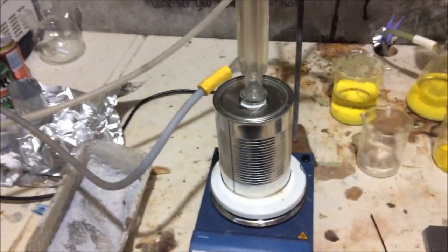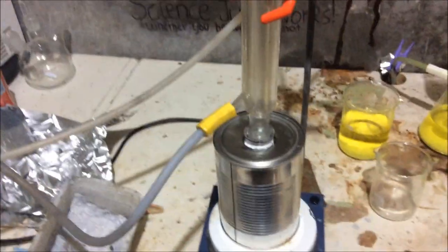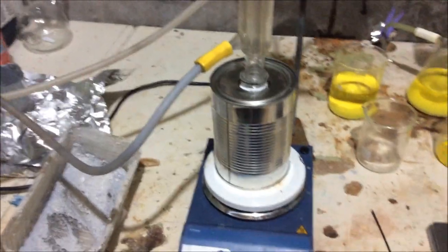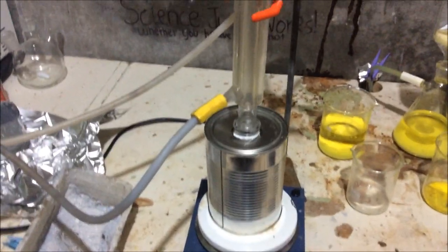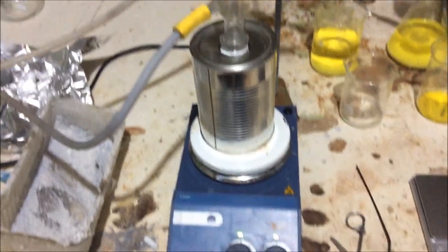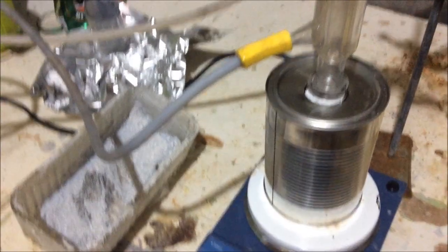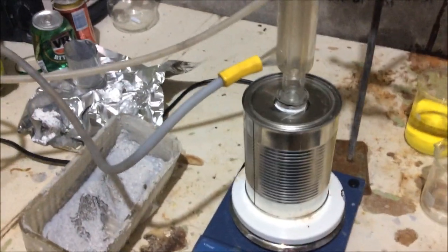The condenser's attached. We're about an hour in and it's refluxing pretty steadily. You can't really see on the camera, but I can see that it's condensing in the condenser and dripping back down. So we're going to leave this for three or so hours until I get tired of this and want to go to bed. And then at that point I'll take it apart and we'll have a look at it and see how much of the plastic we've actually dissolved.